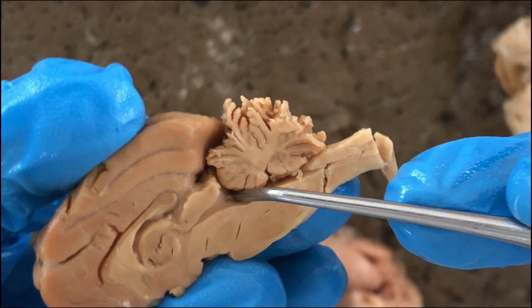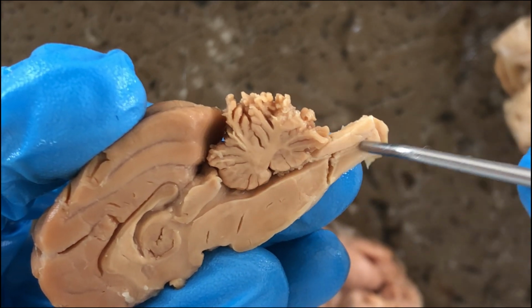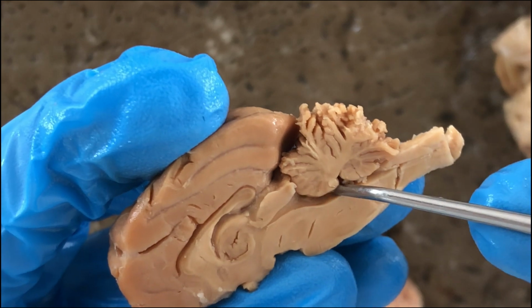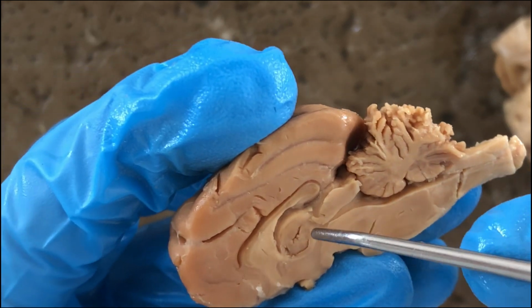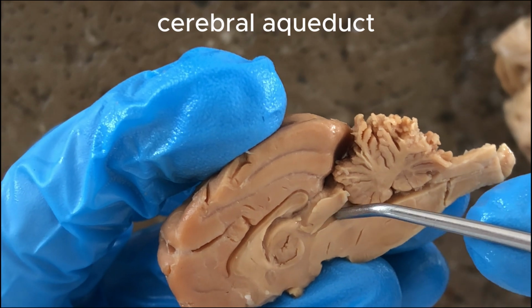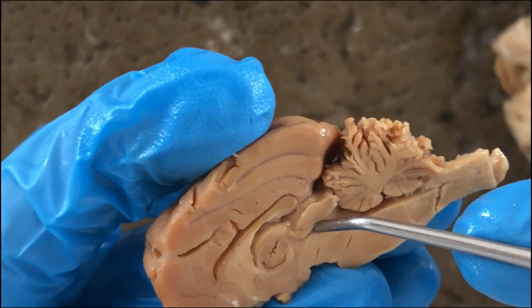And then the fourth ventricle here is located in the hindbrain, the fourth ventricle. And in between the fourth and the third ventricle is the cerebral aqueduct, located in the midbrain.